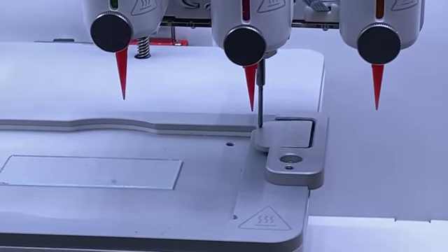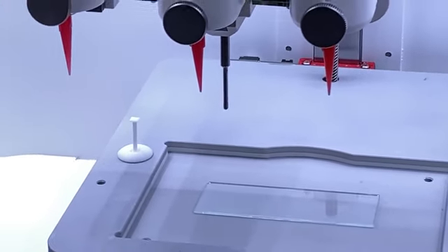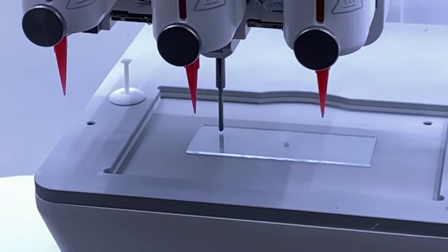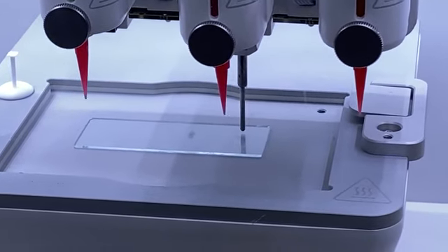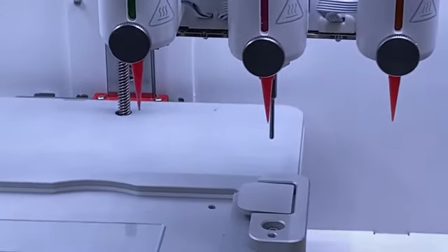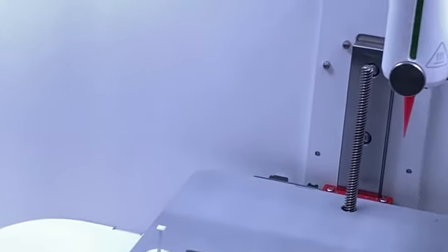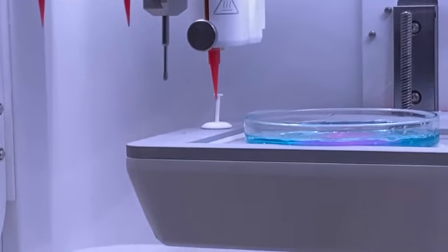So the calibration is a complex process where the machine knows exactly in which position each of the print heads is, where those print heads are in the space. It's a touch. It's a mechanical. You calibrate before every run, before every print? Yeah, exactly. So now it's calibrating the print heads. So it is calibrating the XYs. Little joystick there. Yeah. Looks like a joystick. Yeah.